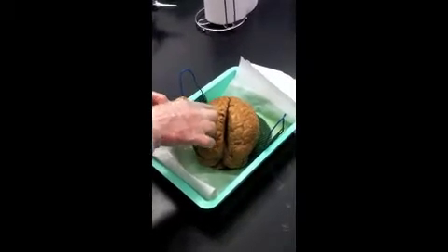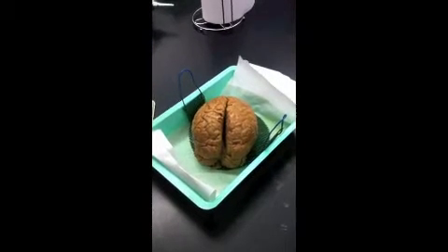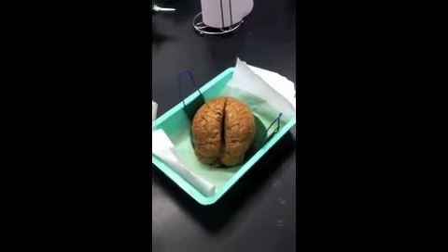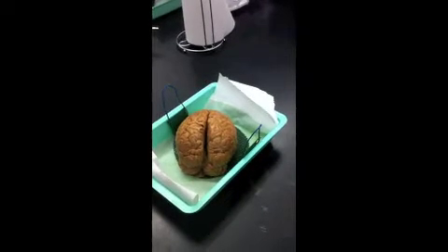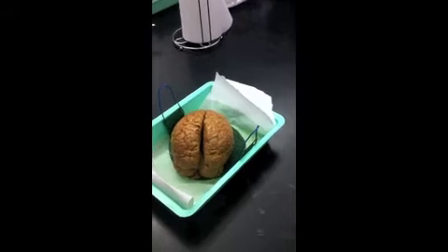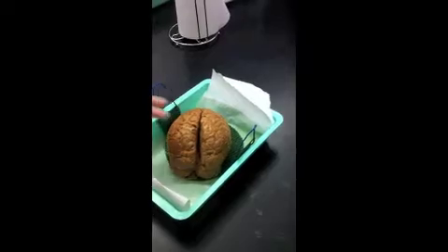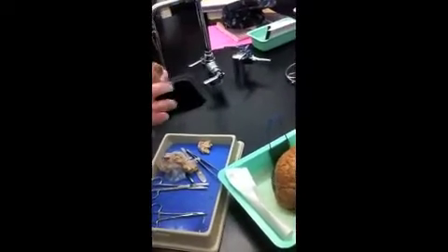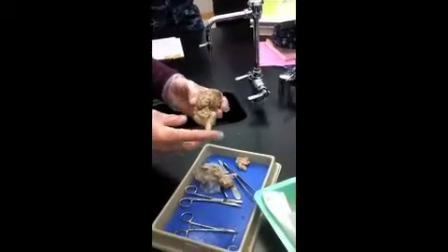Now these ridges increase the surface area of the brain. Like if you had a flat sheet of paper and crumpled it, you could fit it into a smaller space, right? Think of all those folds after crumpling it as gyri. So you're getting more gray matter into the cranium than if the surface was flat. But we have fewer folds or gyri on the sheep brain.